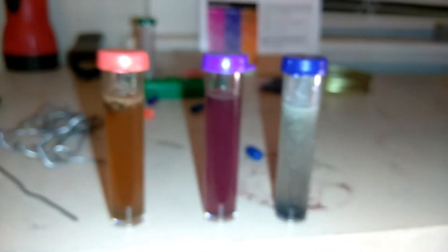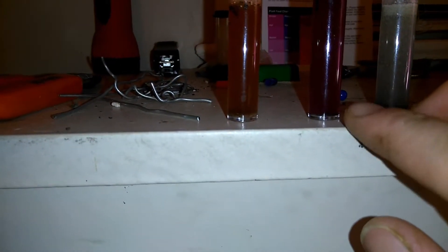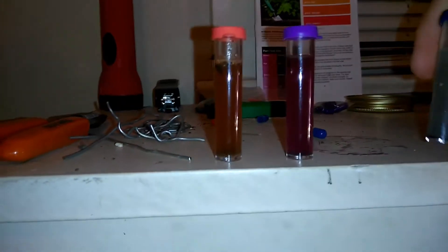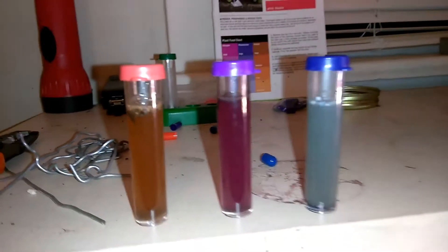And there are your results, clear as day. Nitrogen... blue is phosphorus. Okay, it's not bad. It's on the lower side, but hey, it's vegetating so it's good.